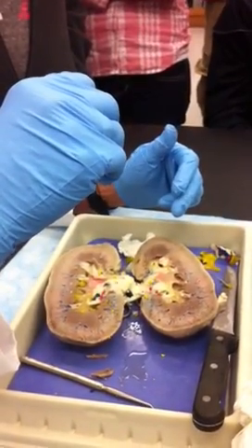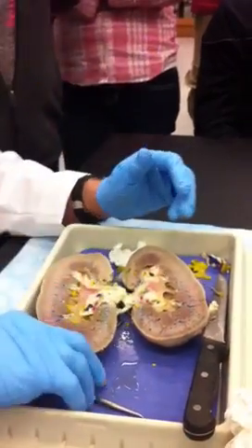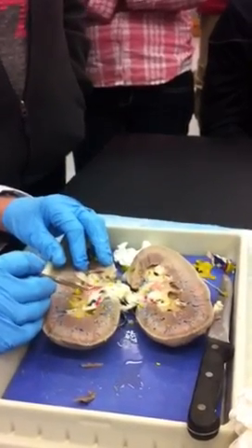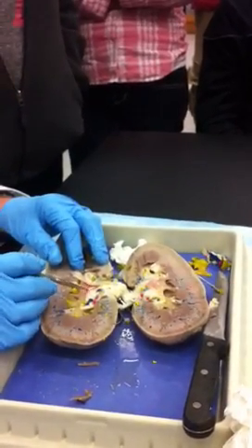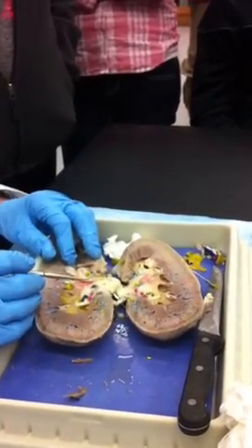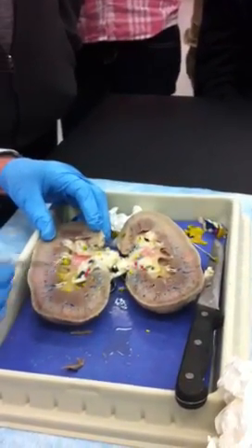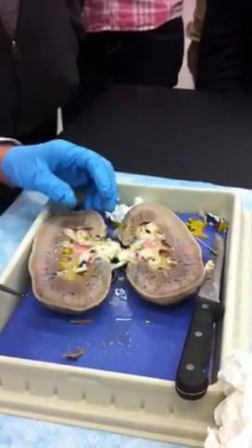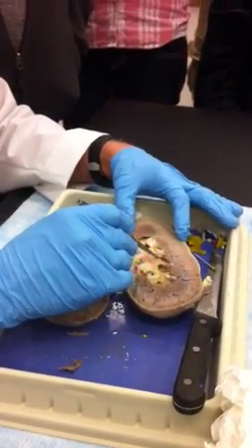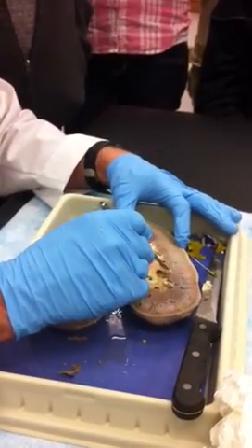Is there any cancer in that big kidney? I've never seen it, but I'm sure there has been — I've never noticed any. I don't know where this red is coming from — that's blood. That's the natural color of the kidney. Just where it's not preserved real well, maybe. Anyway, it's not that difficult, and some of you will get much better pyramids than I got, I'm sure. So get your kidneys and go to it.